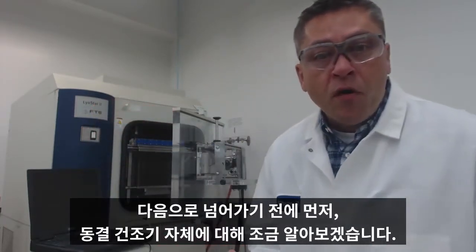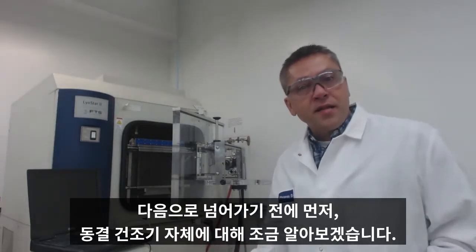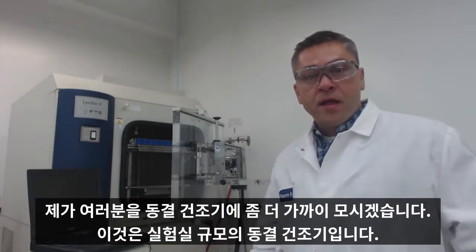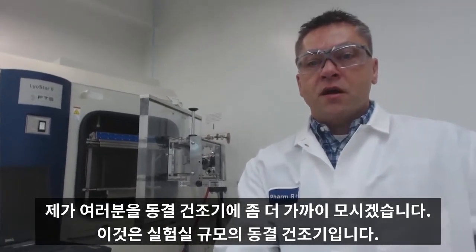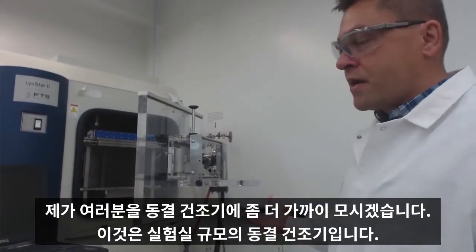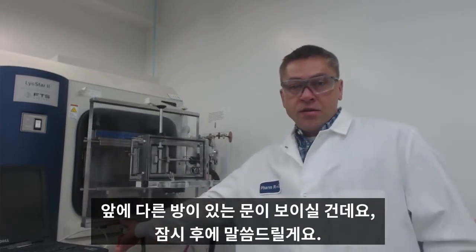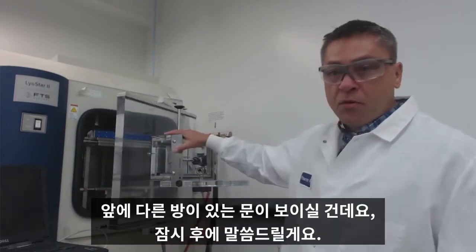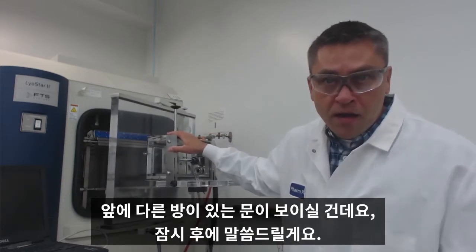Before we move on, let's understand a little bit about the lyophilizer itself. This is a laboratory-scale lyophilizer. You'll see it has a door with another chamber on the front, which I'll talk about in a minute.